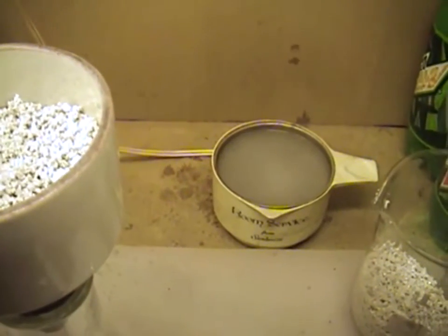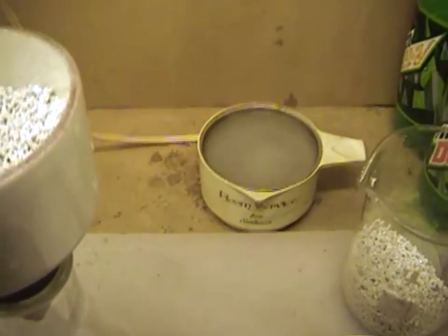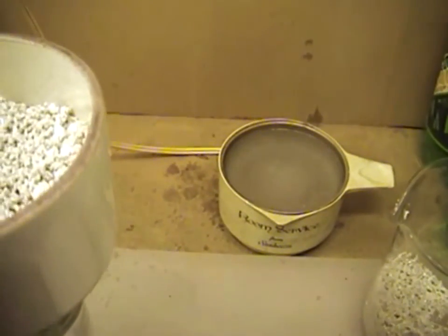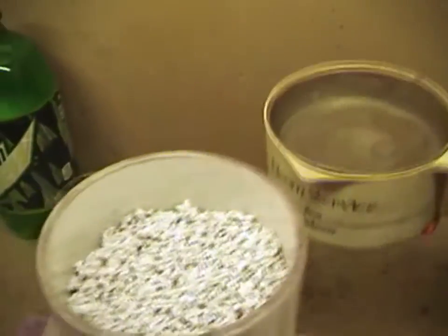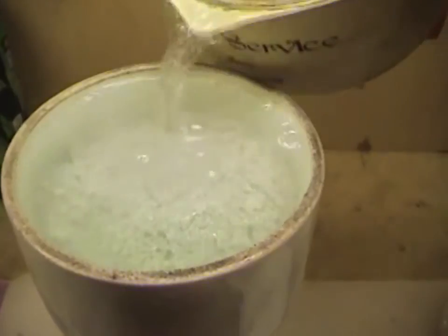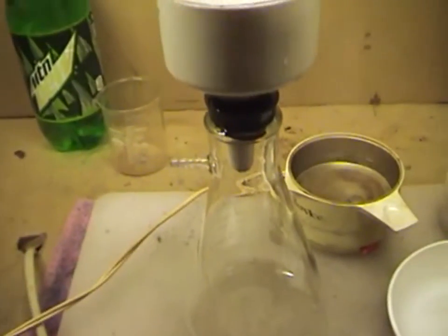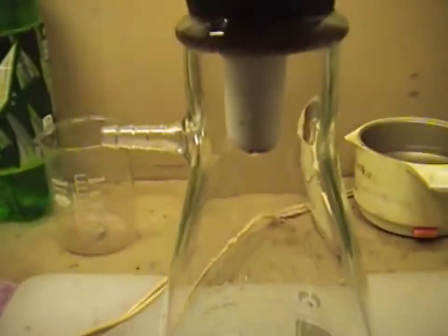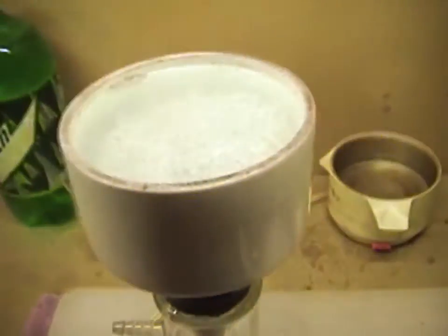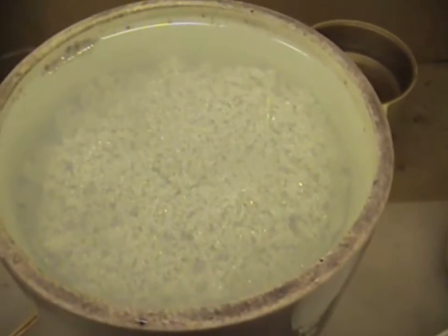The water is getting pretty close to boiling — and we're boiling. So we're going to unplug that and take our water out. We're just going to pour a funnel full of water and allow our crystals to sit in there. From gravity it'll start to drip through the bottom just a little bit. We just want those crystals to sit in there, warm up, and draw off any copper nitrate or silver nitrate that may still be trapped in the crystals.